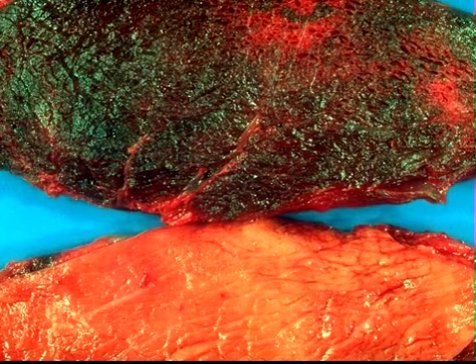Rhabdomyositis means skeletal muscle. And emphysema is very important. It's a very characteristic part of this lesion. You can see the little bubbles here in the muscle, and you have to have that in there for full credit.